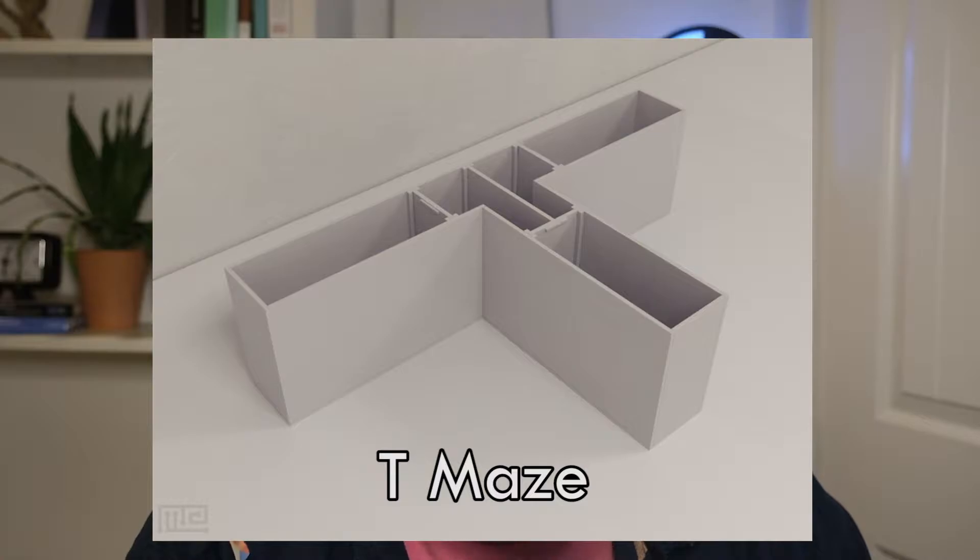If you've seen my recent video on turn alternation, you'll be familiar with our next example: the T maze. A T maze is very simple — it's two long runways put together to form the shape of the letter T. An animal is placed at the bottom of the T, and as it gets to the end of the runway, it has to make a choice: left or right. One choice leads to a reward; the other is just an empty runway.